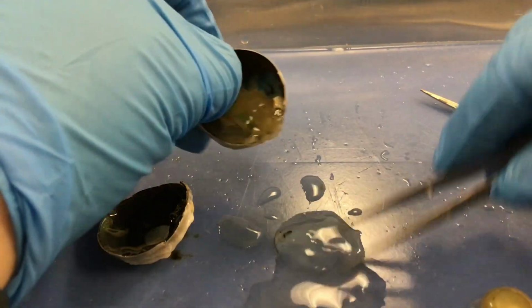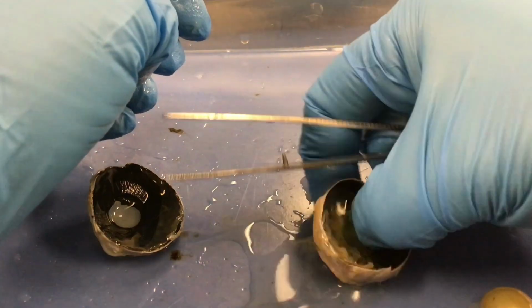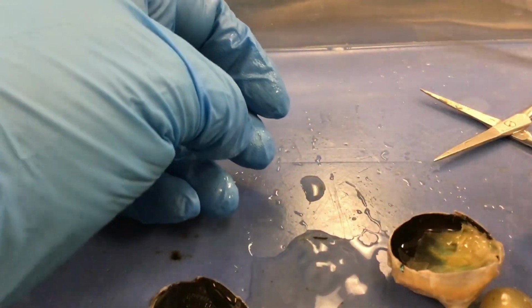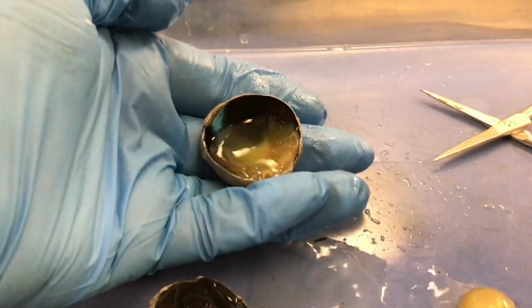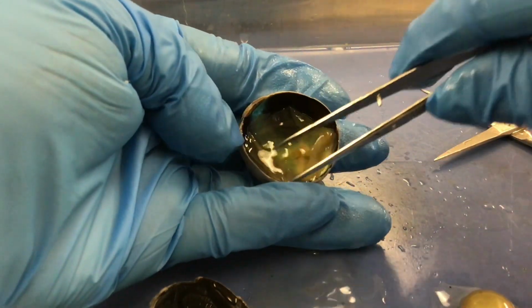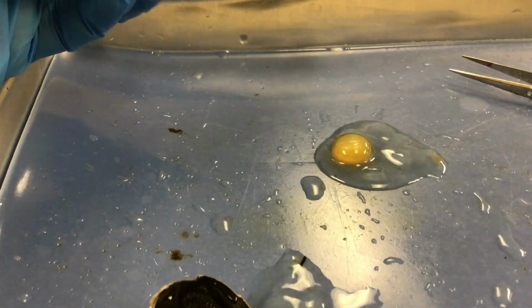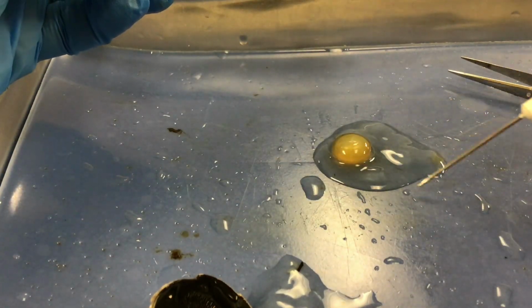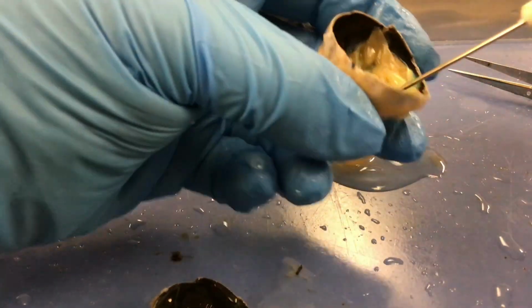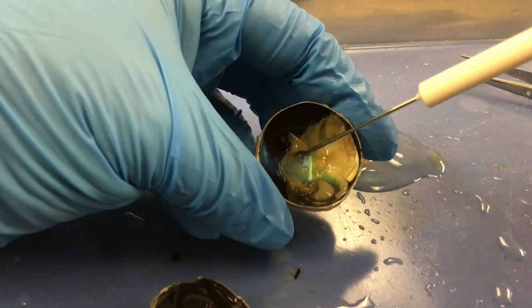Vitreous humor is in the vitreous chamber. It helps to maintain intraocular pressure within the eye and keep that retina flat against the surface of the eye. So you can see the retina here. It has bunched up a little bit. So I have removed the vitreous humor. You can see the lens attached there. So there's the lens and then the vitreous humor. And I tried to flatten the retina back against the back of the eyeball.